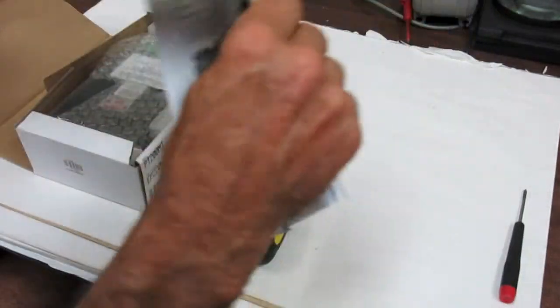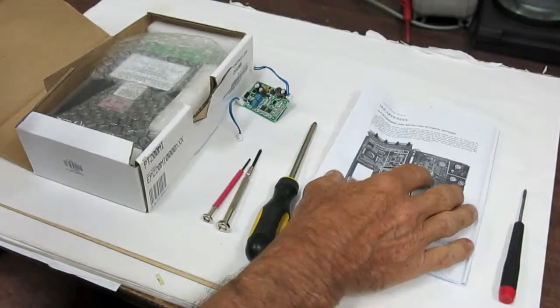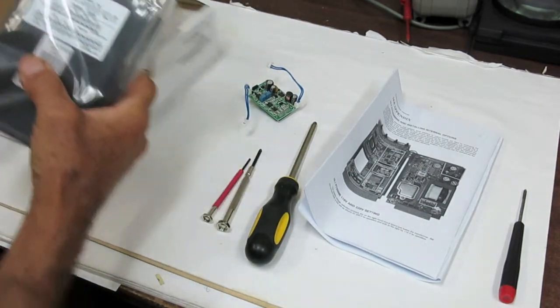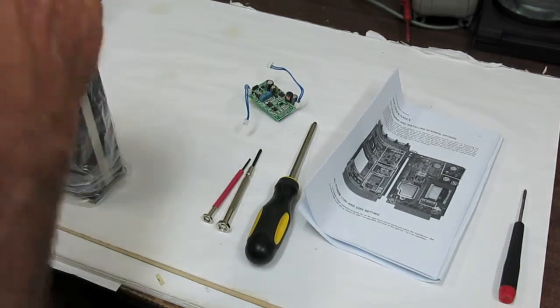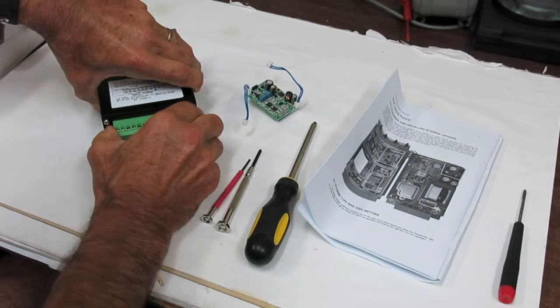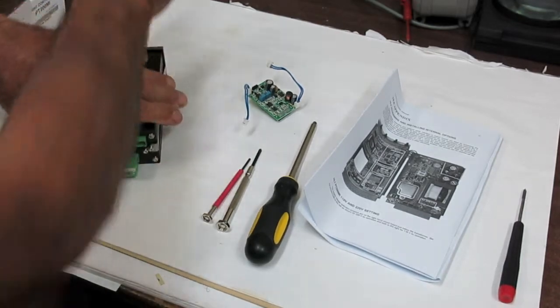Unpack the display, remove the connectors from the rear of the display.